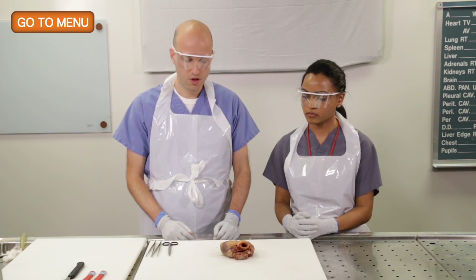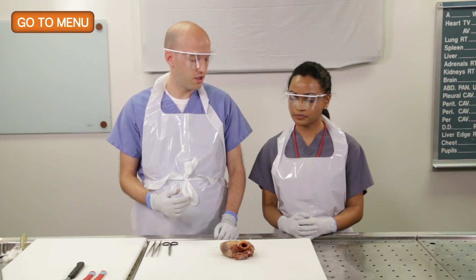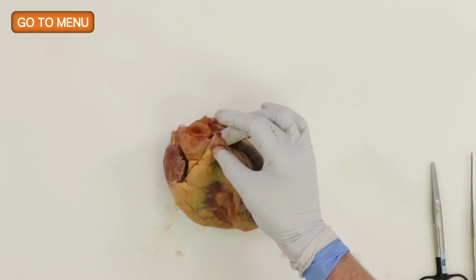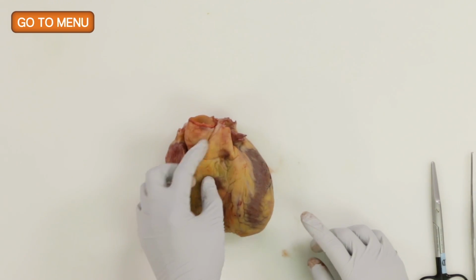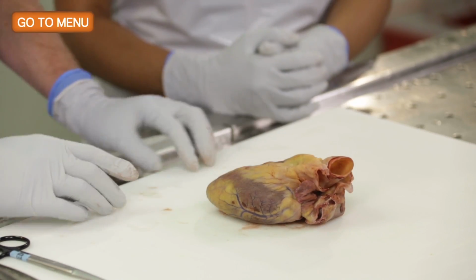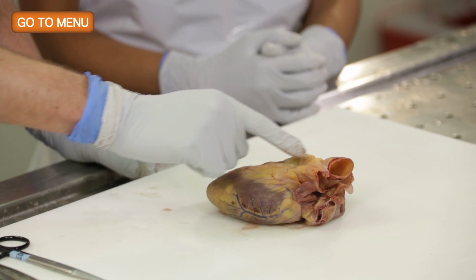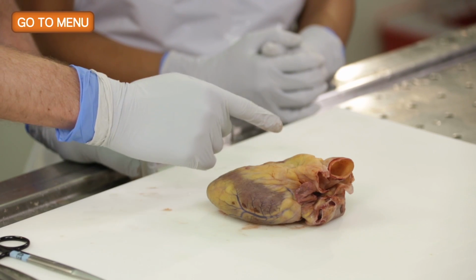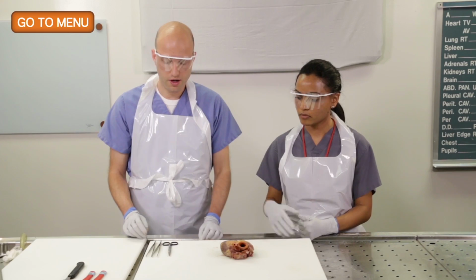All right, so the first thing you want to do is to reflect the pulmonary artery, which is this structure here. The reason we do that is it's normally adherent to the top of the aorta, and we need to get it off of there because our final cut is going to be from the left ventricle up through the aorta, through this distribution. So we need to get this vessel reflected this way and out of the way, or else we'll cut across it. So why don't you go ahead and start with that.